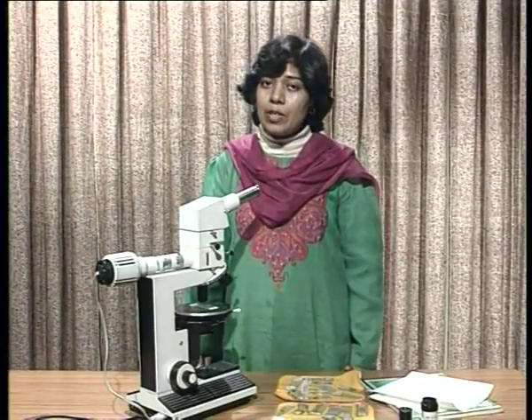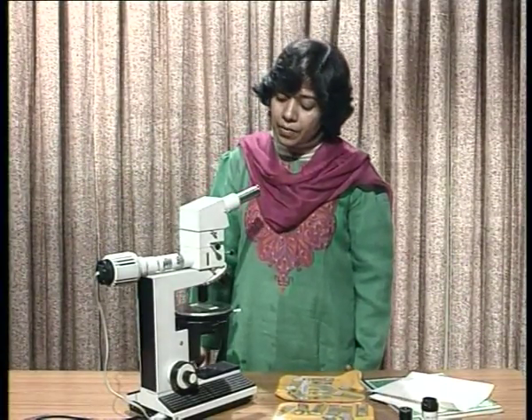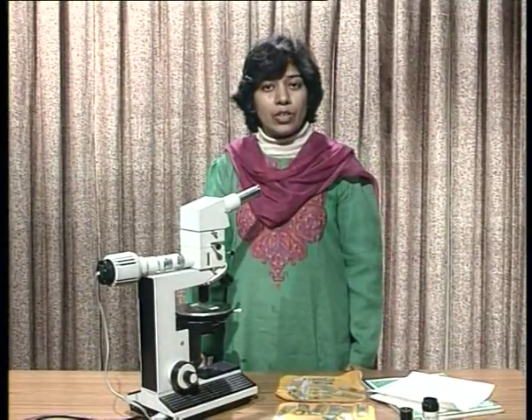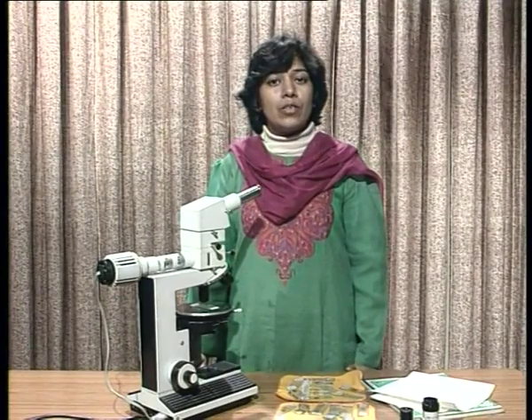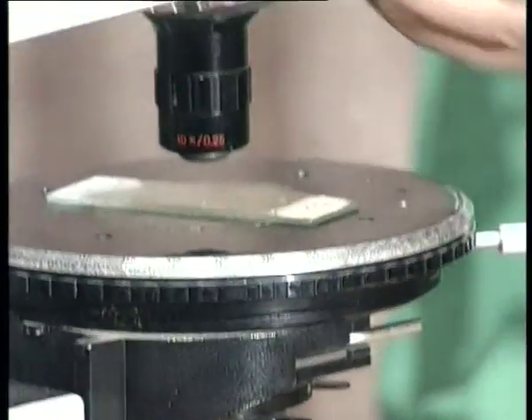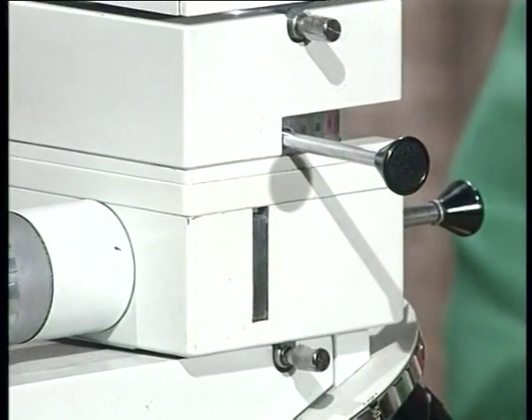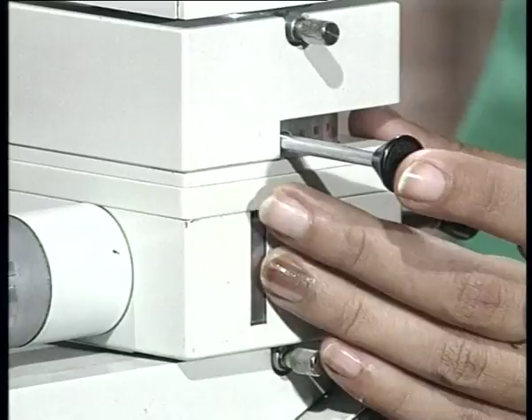Let us now observe some important optical properties of minerals in thin section. We will make these observations in two different modes: in plain polarized light when the analyzer is out of path, and in crossed position when the analyzer is inserted.